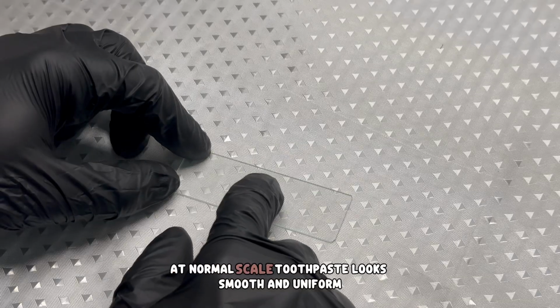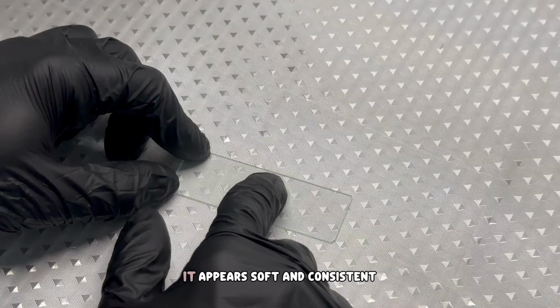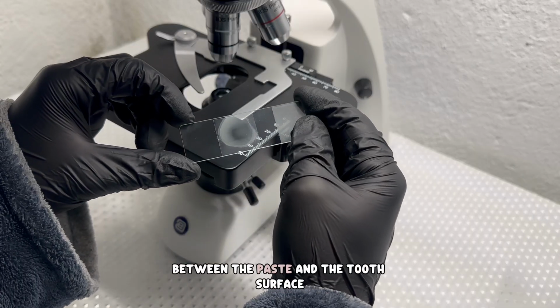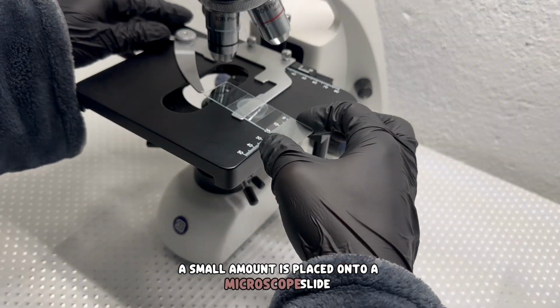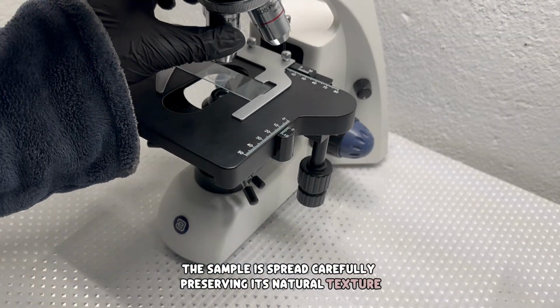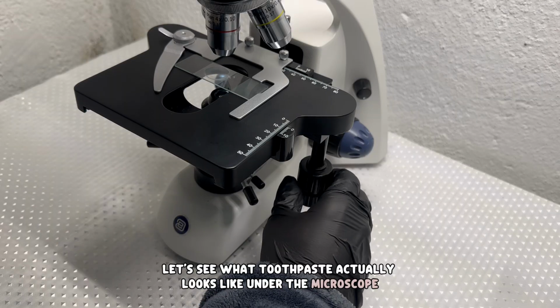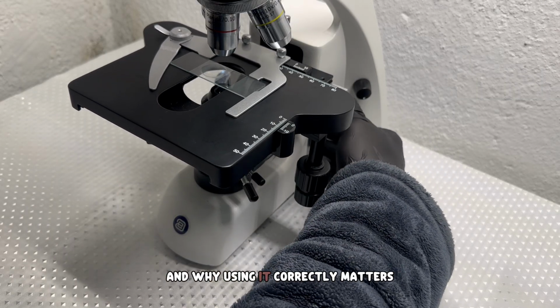At normal scale, toothpaste looks smooth and uniform. Whether white or gel-based, it appears soft and consistent. But this cleaning effect depends on microscopic interaction between the paste and the tooth surface. A small amount is placed onto a microscope slide. The sample is spread carefully, preserving its natural texture. Now it is time to take a closer look. Let's see what toothpaste actually looks like under the microscope and how its structure helps it clean, and why using it correctly matters.